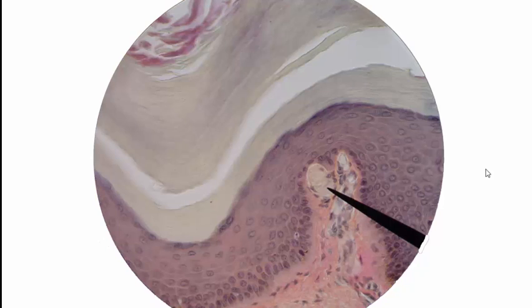Moving on to the next picture, also another image of thick skin at 450 times magnification. I like to show you several pictures of the same thing that look a little bit different so that you get a feel for the features. That's what I'm trying to get to. Outermost, again, is stratum corneum, and then down here would be stratum lucidum, close to this next layer, which is stratum granulosum. And then we have stratum spinosum, and then finally stratum basal.